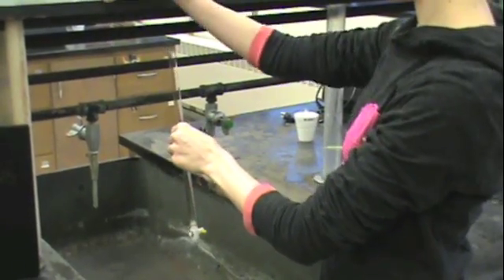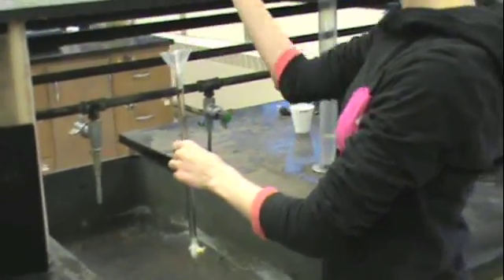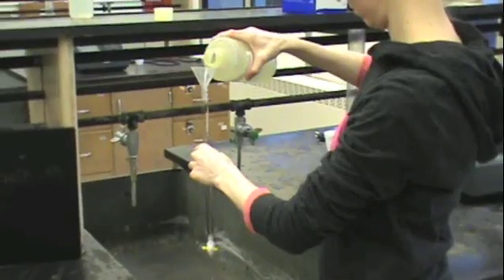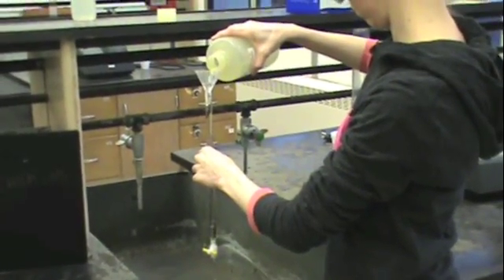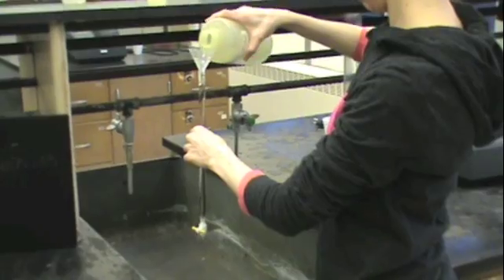Now obtain a funnel again, and this time we're just going to fill the burette. So make sure that it's stoppered at the bottom and fill it with your reagent to the level that you want it to be at.